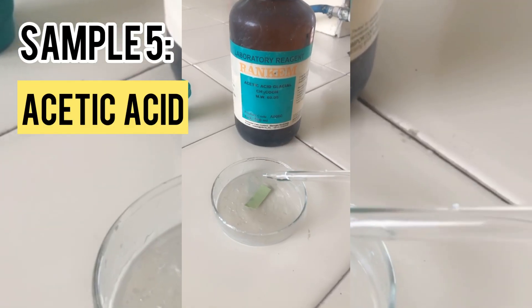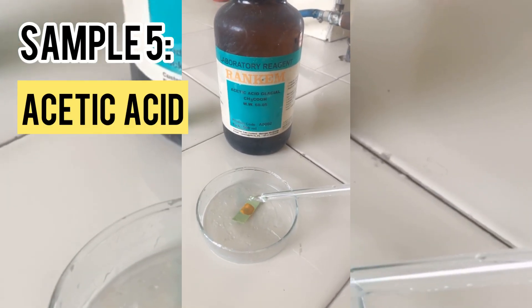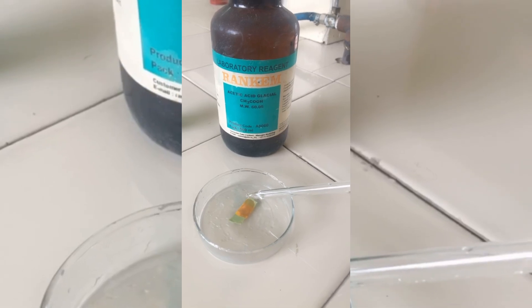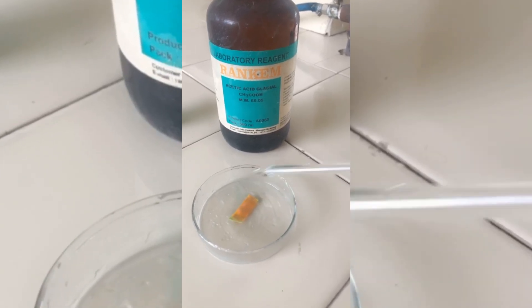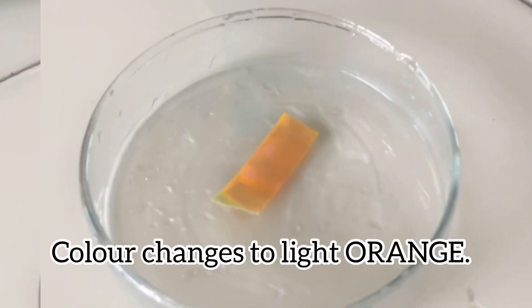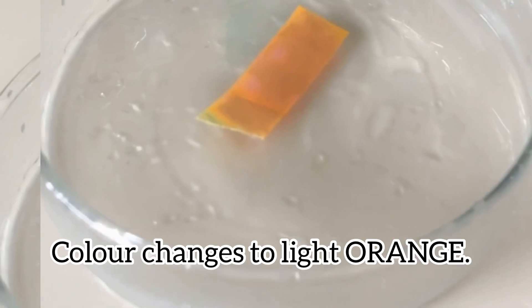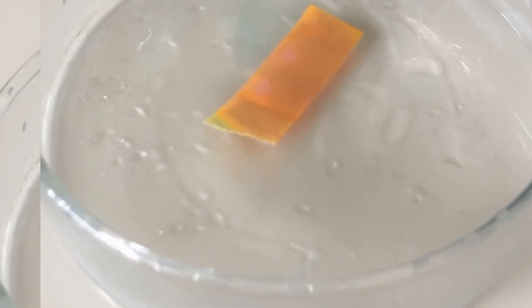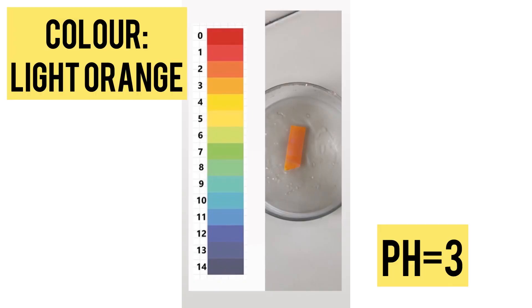The next sample is acetic acid. It is a weak acid. You can see the color is changing to yellowish orange, meaning light orange. We can say the pH is 3.